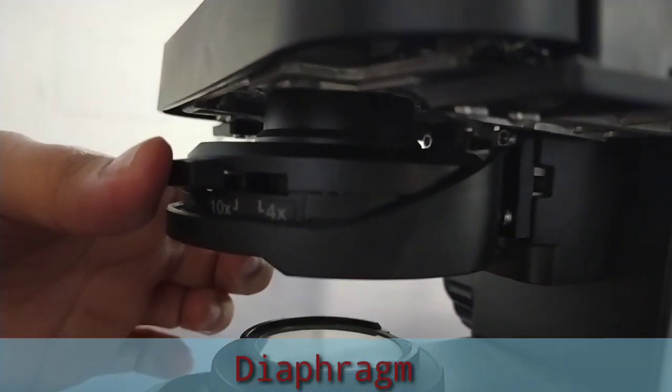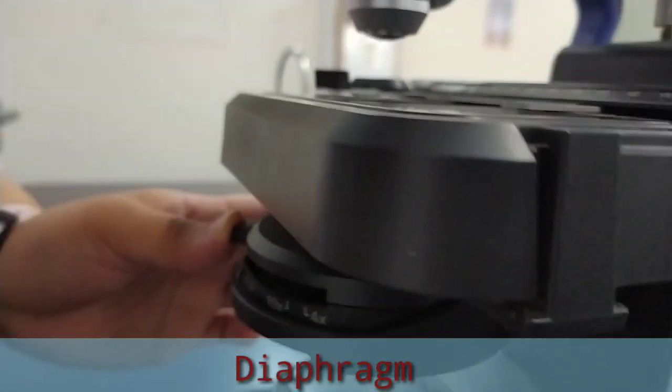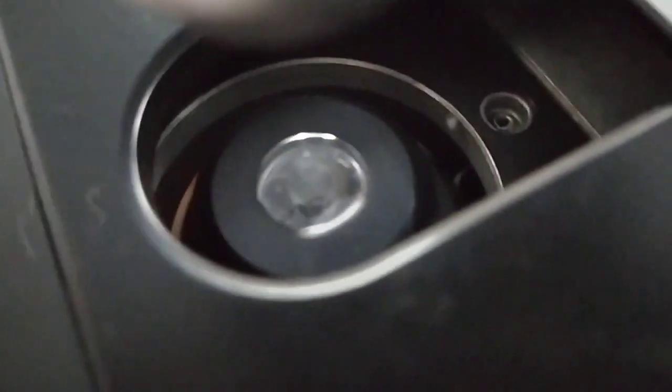Diaphragm. Diaphragm helps in controlling the amount of light that is passing through the opening of the stage. It is helpful in the adjustment of the control of light that enters.